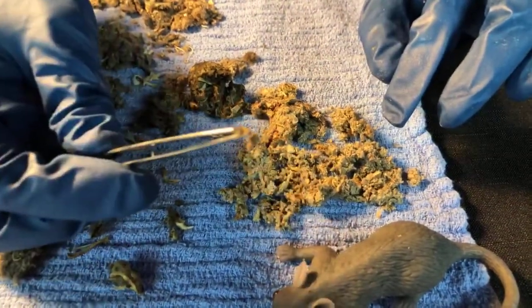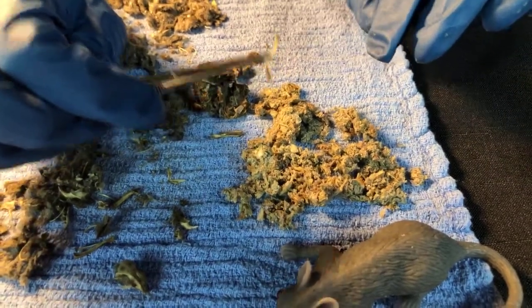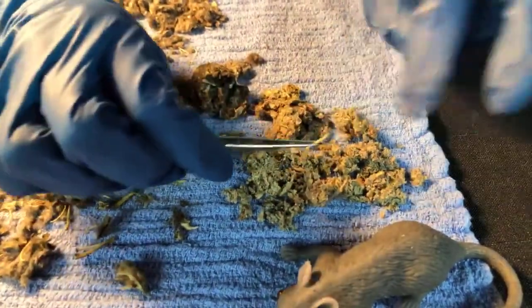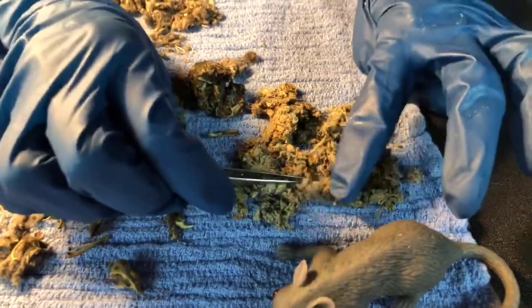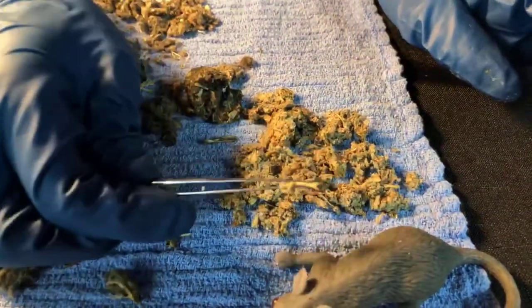So like a scrub jay? Would a scrub jay cough up a pellet? He's not eating meat. He's eating seeds. Right. So probably not. You'd have to be a larger bird that actually eats meat. So a fish bone, is that what we found in there? Yes, it looks like a fish bone to me.